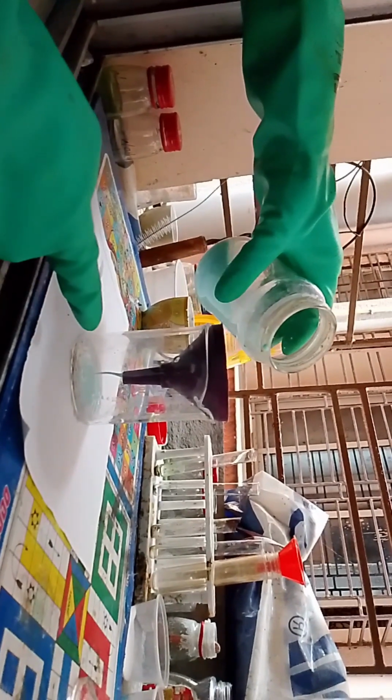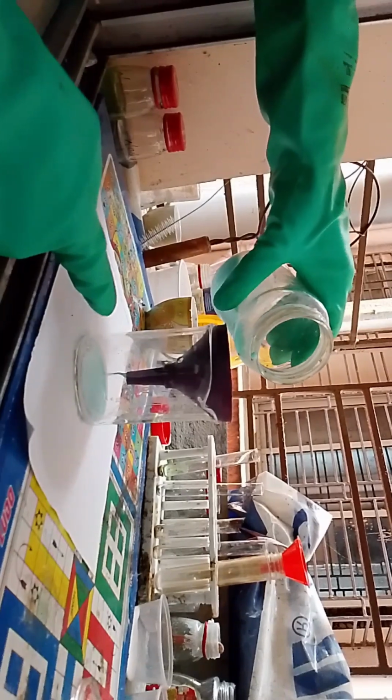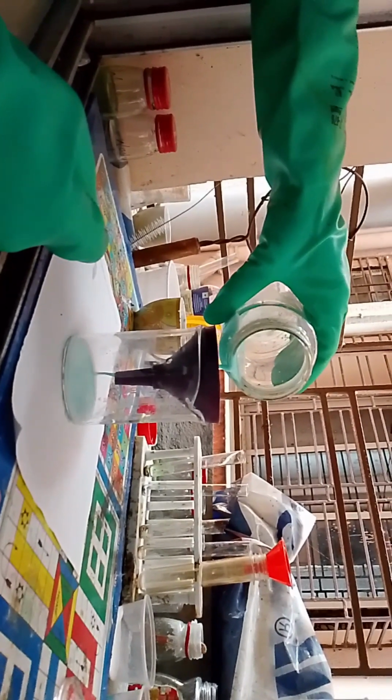A layer of crystal clear liquid is forming just above the blue turbidity here. Okay, that is our prized acid, but this time I hope after a few more filtrations we are going to take out most of the thing. It is still only a little clear this time. I hope everything goes as planned.